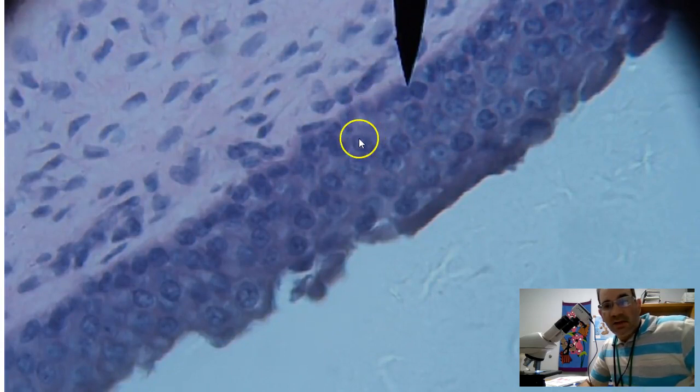They're round down at the bottom, but they're not really clustered at the bottom. They seem to be just uniformly distributed throughout the epithelium. Focus in on the outer layers here. These nuclei are all rounded, as opposed to stratified squamous, where when you get to the outer edge here, the nuclei become flattened. So that's a dead giveaway that you've got transitional epithelium.